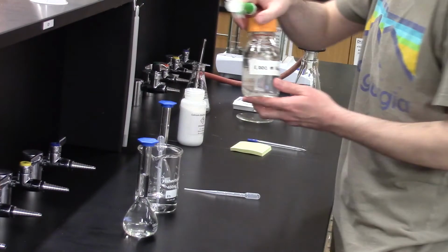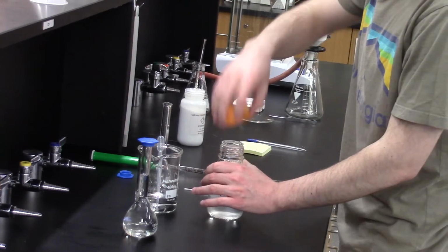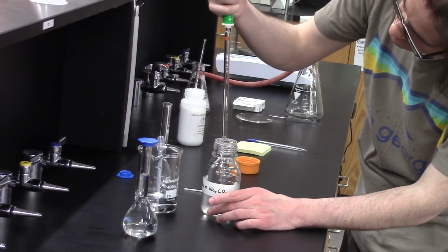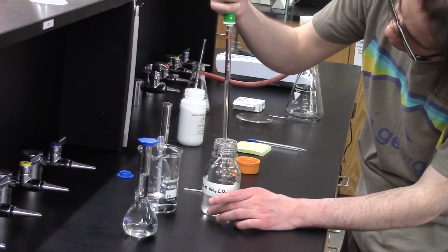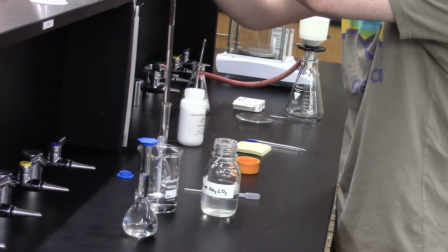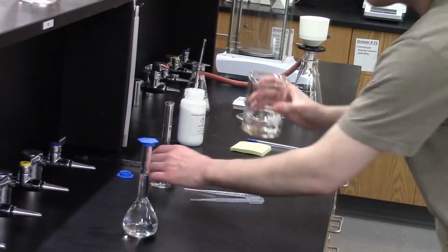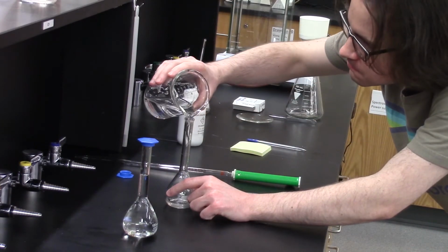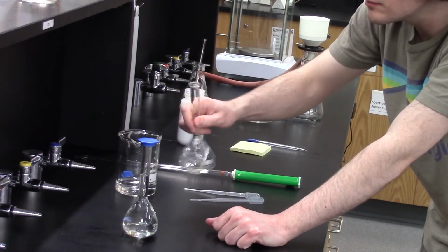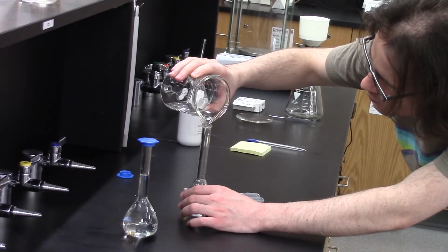Now let's make the sodium carbonate solution. For this, we're going to need to dilute a more concentrated solution to a lower concentration. I use a graduated pipette to measure 10.00 milliliters of the 1.000 molar sodium carbonate solution and transfer it to an empty volumetric flask. I then add about 1/2 of the water and mix before carefully adding the remaining water to reach the 100 milliliter line on the flask. I cap and mix the flask again before topping it off.